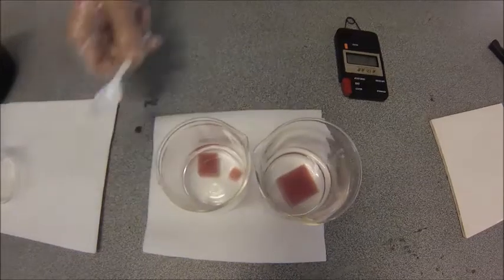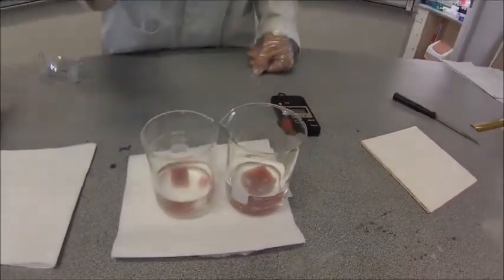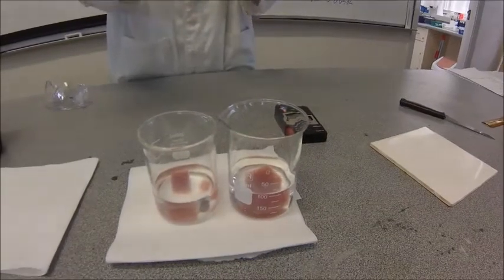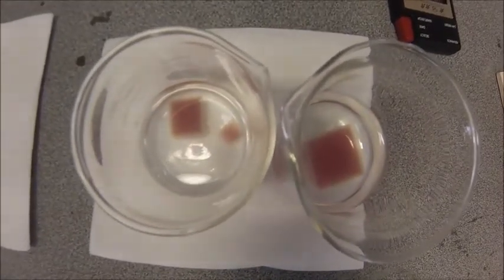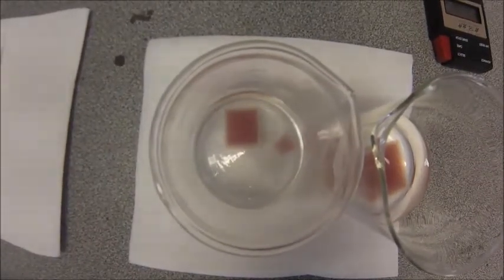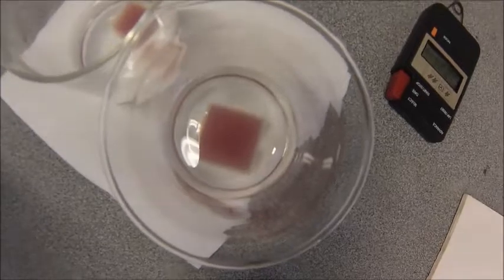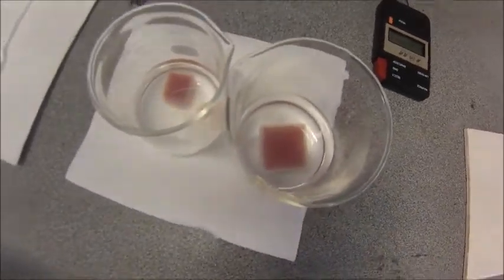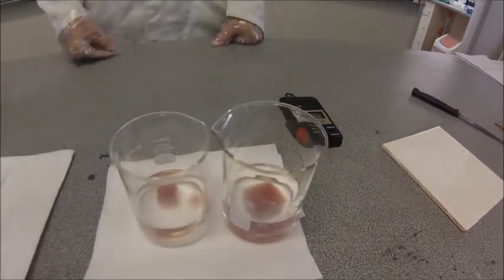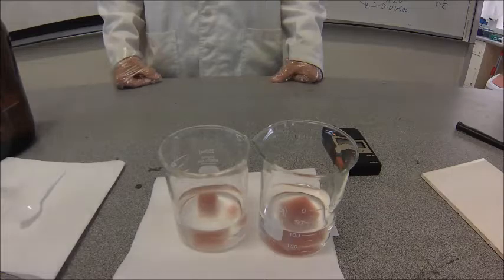Now you basically just wait for the process to occur — normally about eight to nine minutes should be enough. What you're looking for is the first cube that almost loses all its color; when it's getting close but still has some color in the middle, that's when you want to stop. After a few minutes you can see the very outside of the cubes starting to go clear, as the sulfuric acid diffuses in and neutralizes the base. You'll notice roughly equal diffusion occurring across all the cubes.